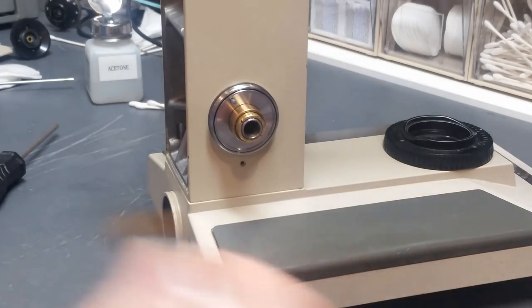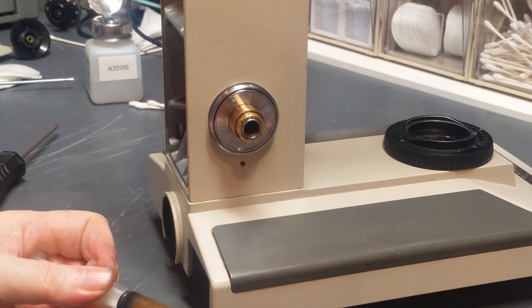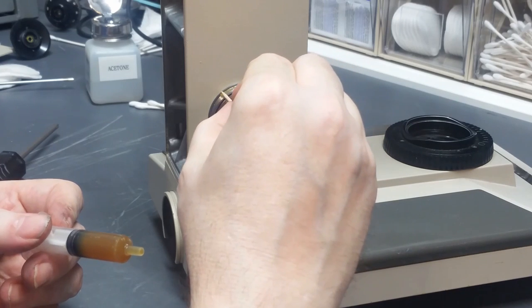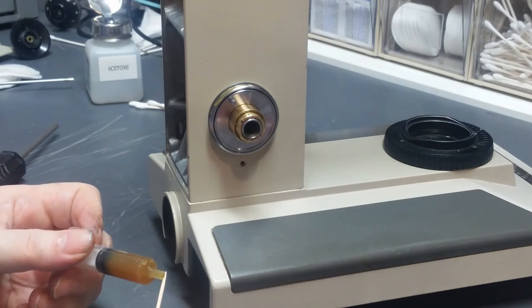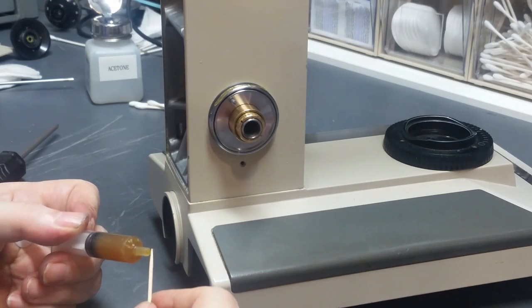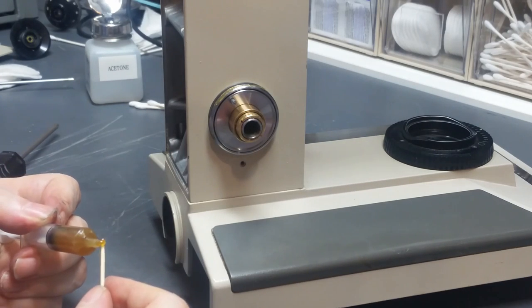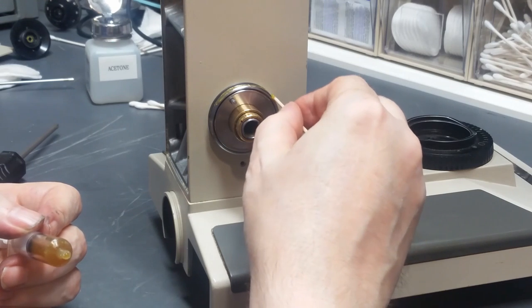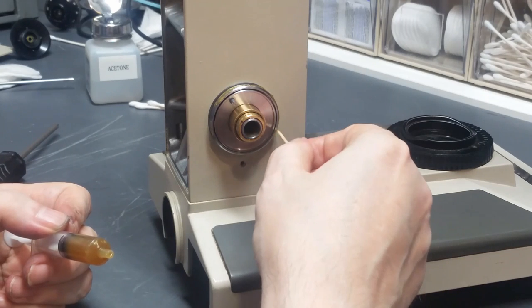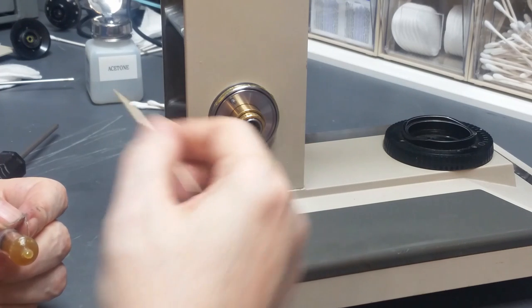So my next step is, by hook or by crook, but primarily by being as careful as I can, I'm going to take Plastilube brake grease, and I'm going to distribute it around the outer circumference of these threads, being very careful not to get any on that inside disc, otherwise the whole mission's scrapped at that point, because it ain't going to work if it's got grease in there. And just a little bit more. Okay.